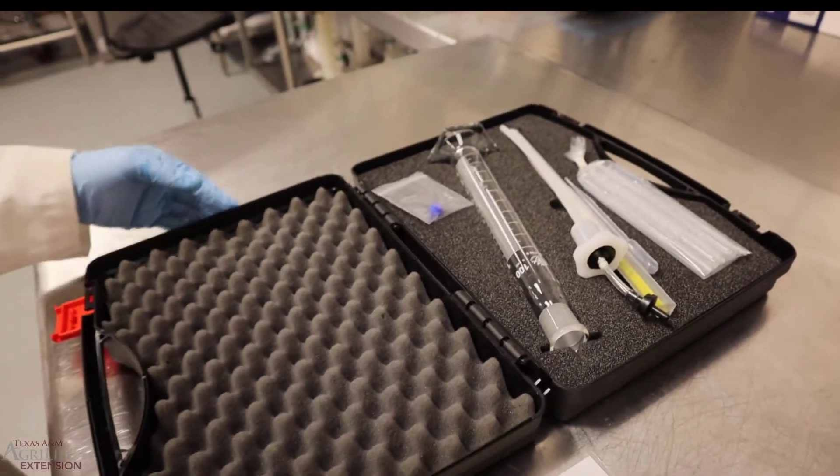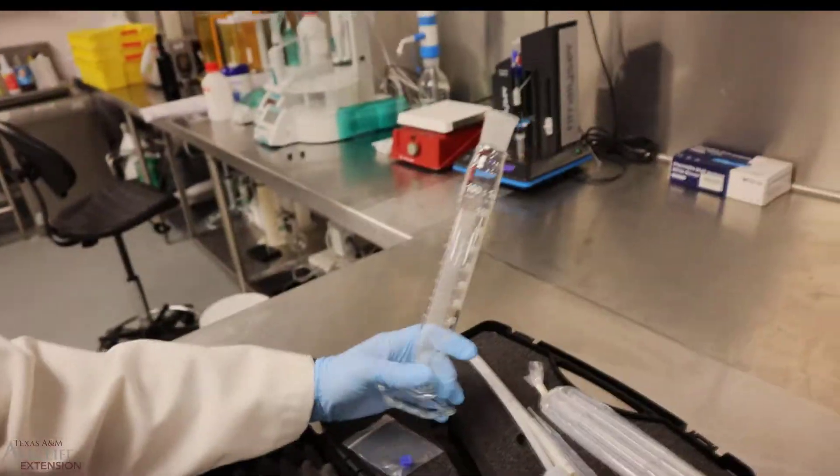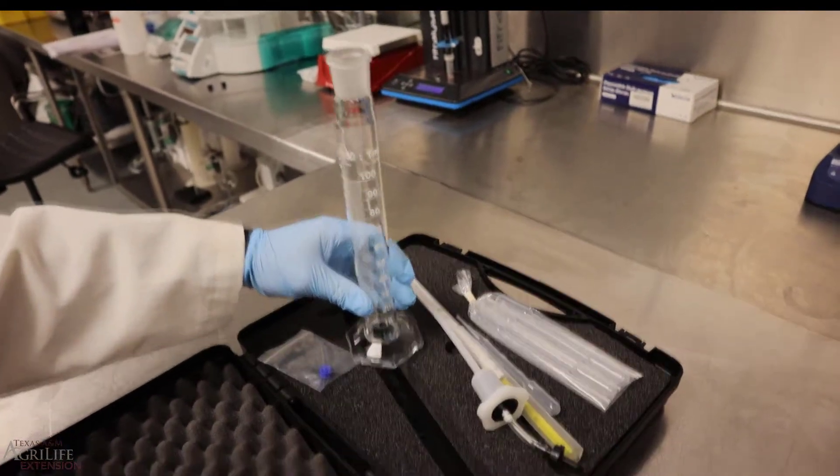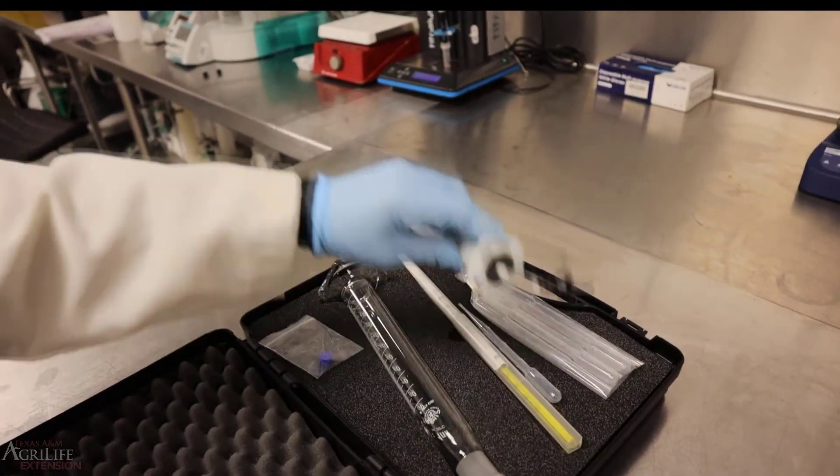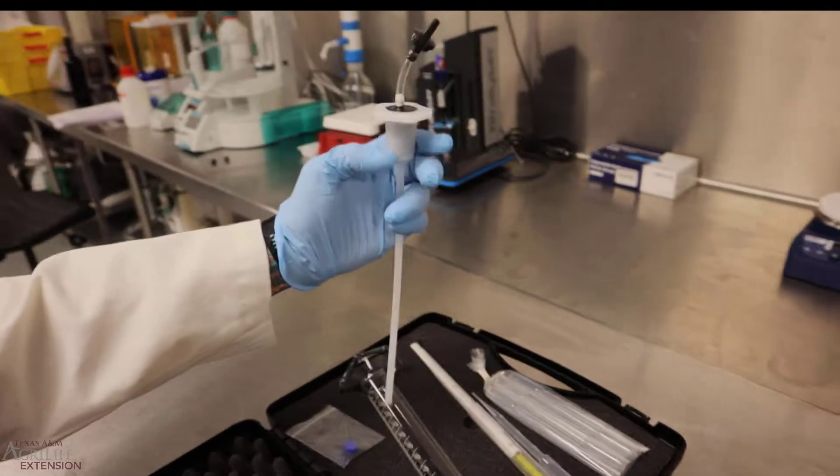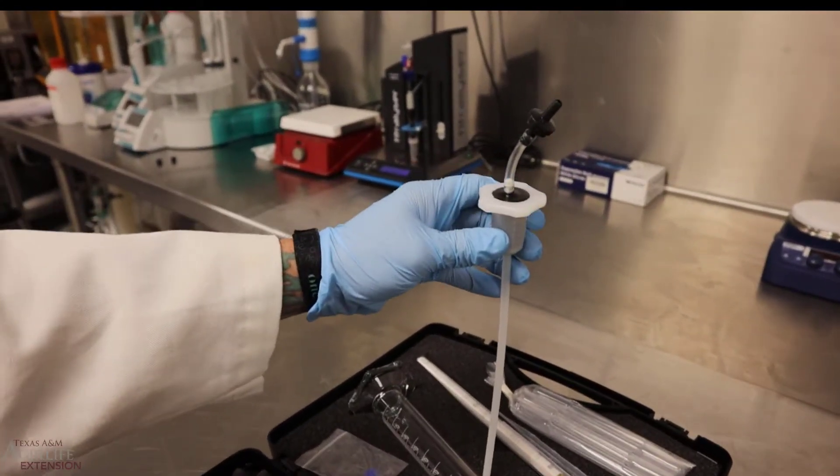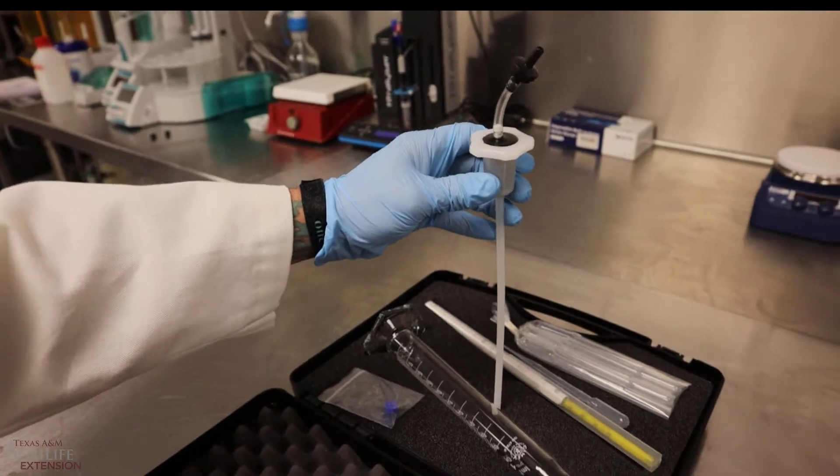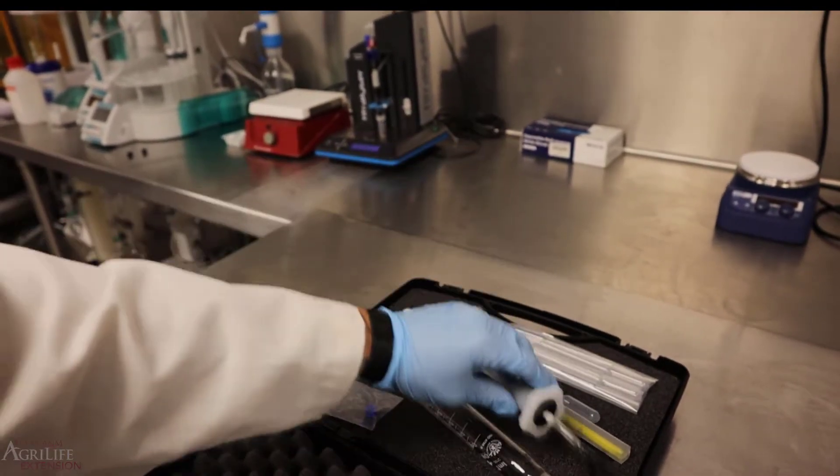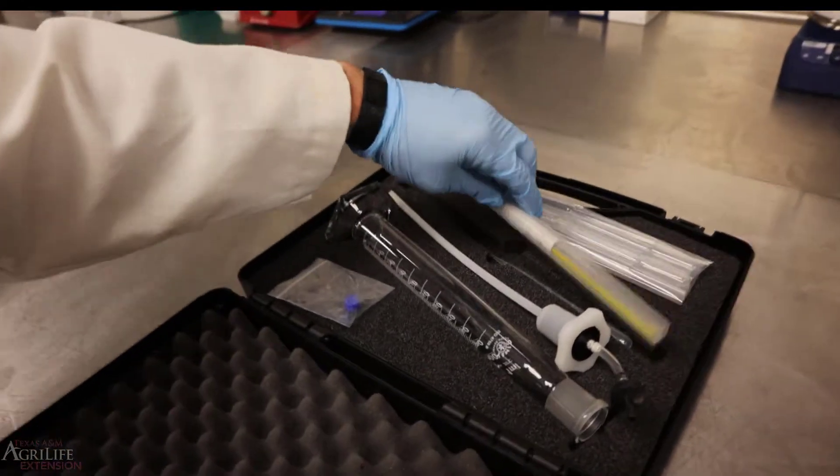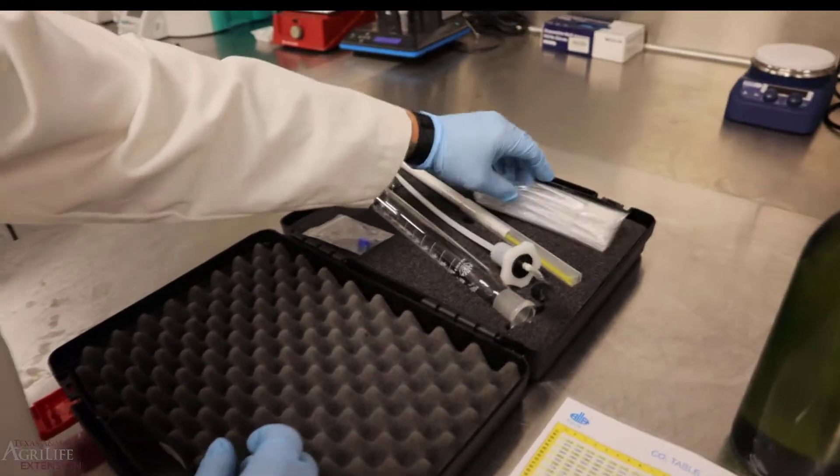Inside the kit you can find a 100 ml cylinder with a special fitting on top. You'll find the piece that goes into the 100 ml cylinder. It's a straw that you'll be putting inside to close it off and you will shake the cylinder. Usually a temperature probe or thermometer comes with it and some pipettes.